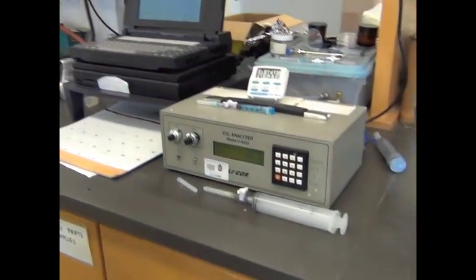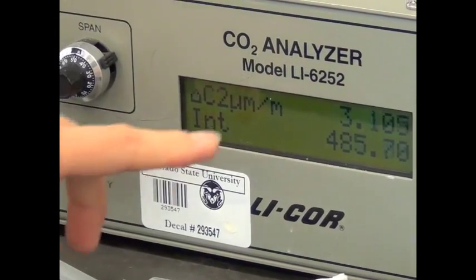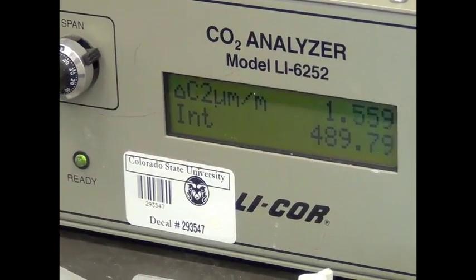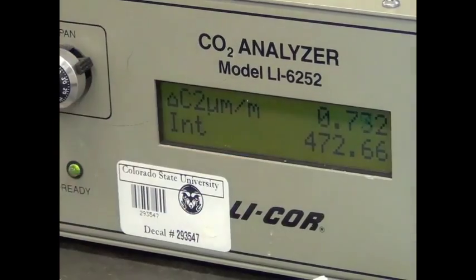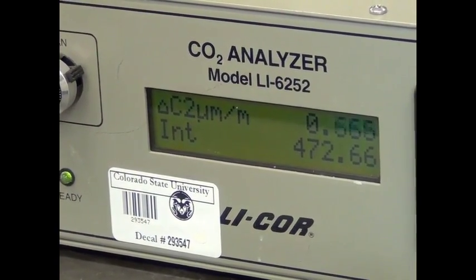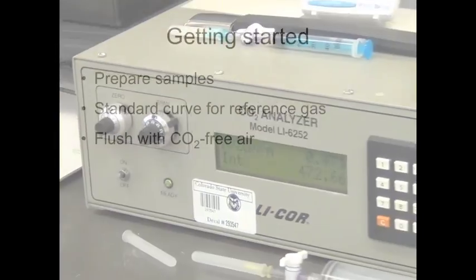And then we'll do the exact same thing again for the 4 mls, the 6 mls, the 8 mls, and the 10 mls. And you can see right now it's integrating the area underneath the curve. And so this bottom number is our final number. So our value for the 2 ml was 472.66.